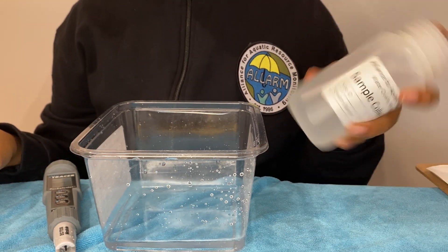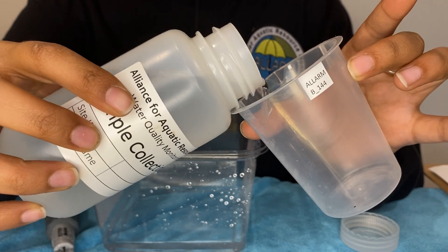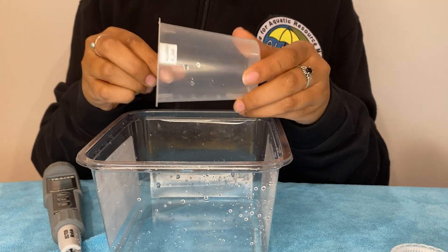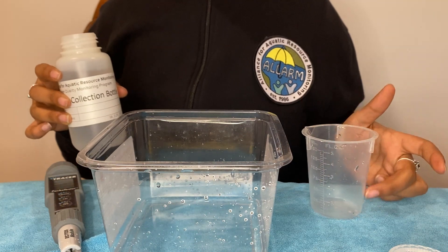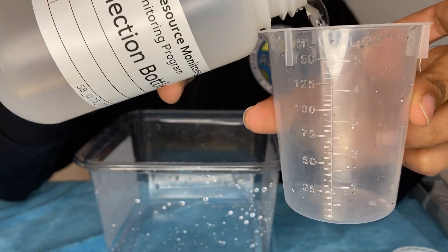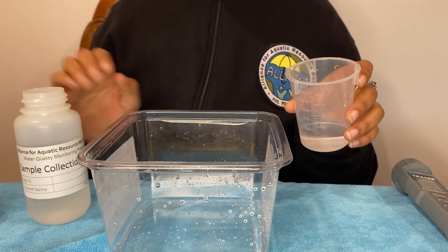Now we are ready to test our water sample. Rinse the beaker that you will be using for your sample water with your sample water three times. A little goes a long way — you can pour a little bit of sample water into your beaker and roll it around over your liquid waste bucket to ensure all of the sides are coated. Do this three times. Then put just enough sample water to cover the electrodes into your beaker for testing. If you pour too much sample water into your beaker, do not pour that water back into the sample bottle, to avoid any contamination of your original water sample. Just pour a bit out into your liquid waste container.